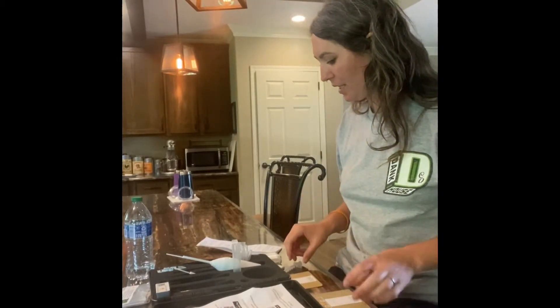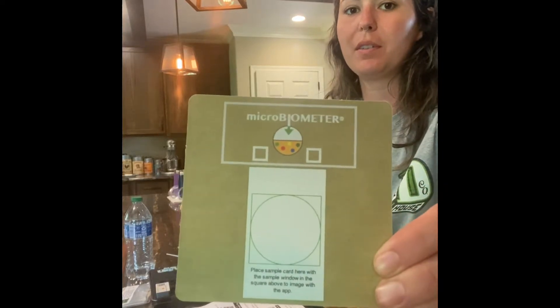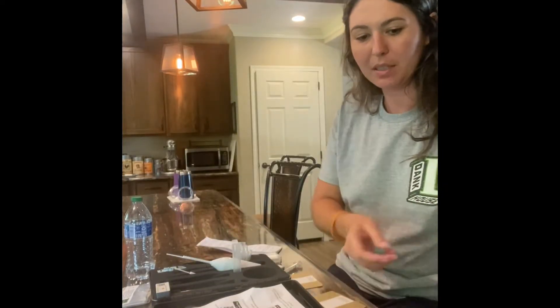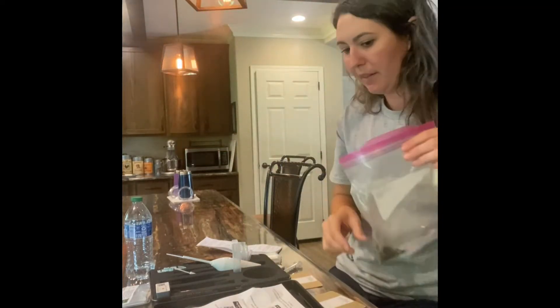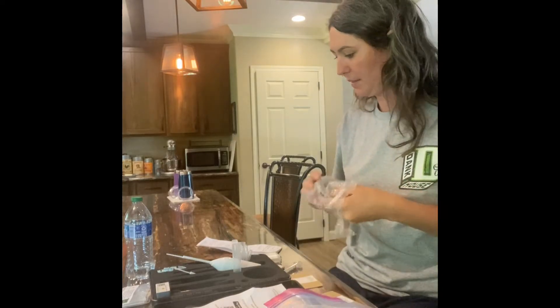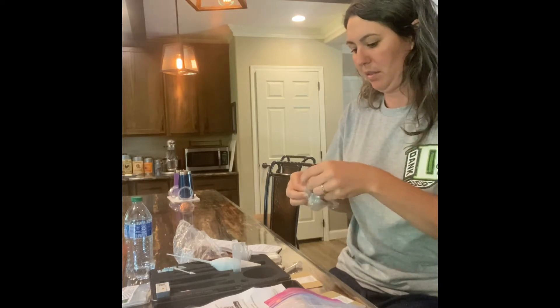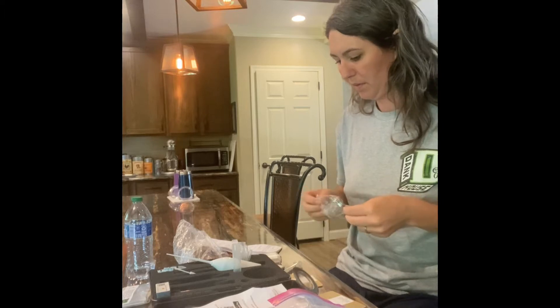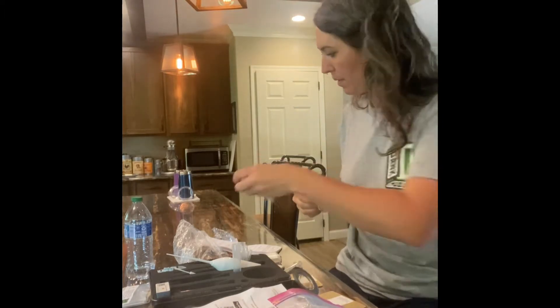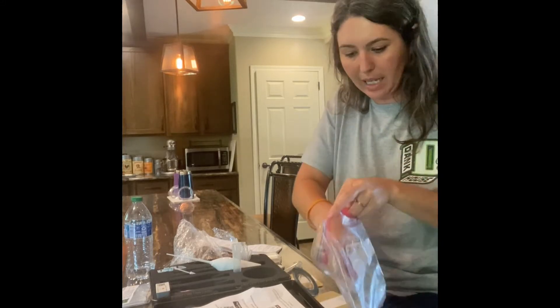We are trying out a microbiometer for the first time. We've got a sample of Gnarly Roots Cannabis soil. First thing we're going to do is sift it — we're going to put this little handy sifter directly into the soil bag.